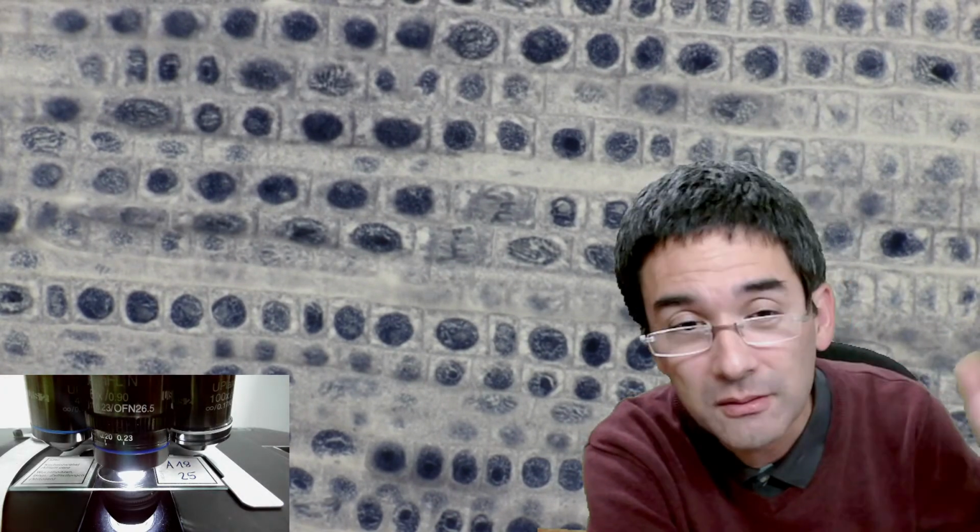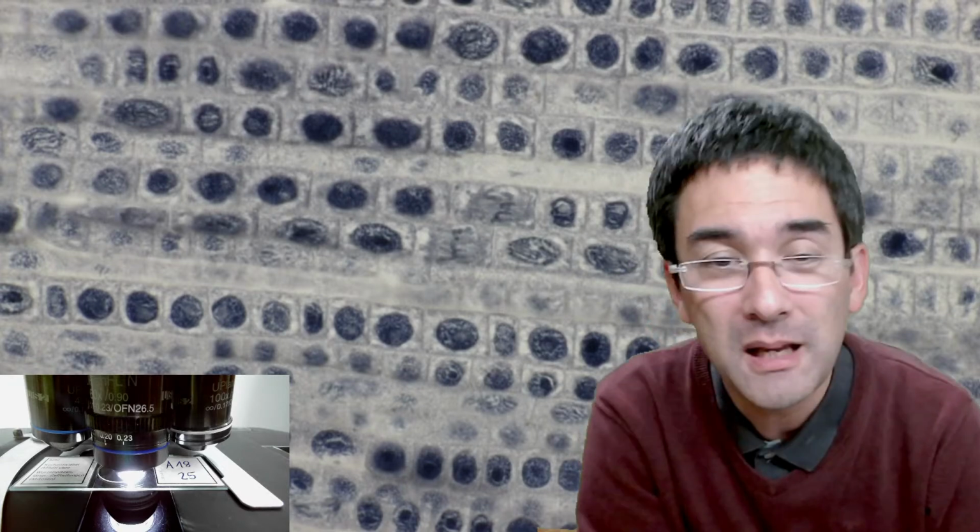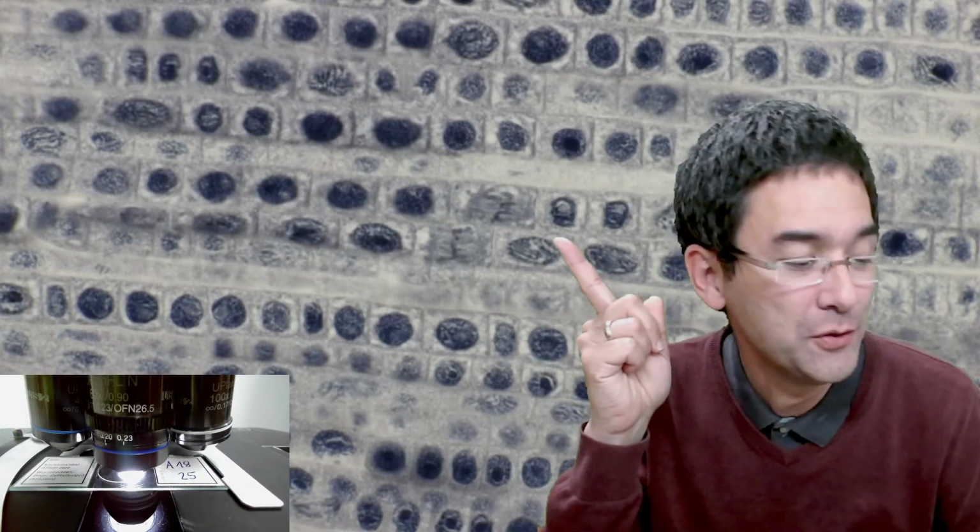Okay, just a side issue, but maybe you've actually seen already, I can see two cells that are in metaphase. Again, over here, my finger starts to disappear. I'm pointing now here. You see there's this dark line going down in the center, this is the equator, and then you see chromosomes pointing out towards the side.